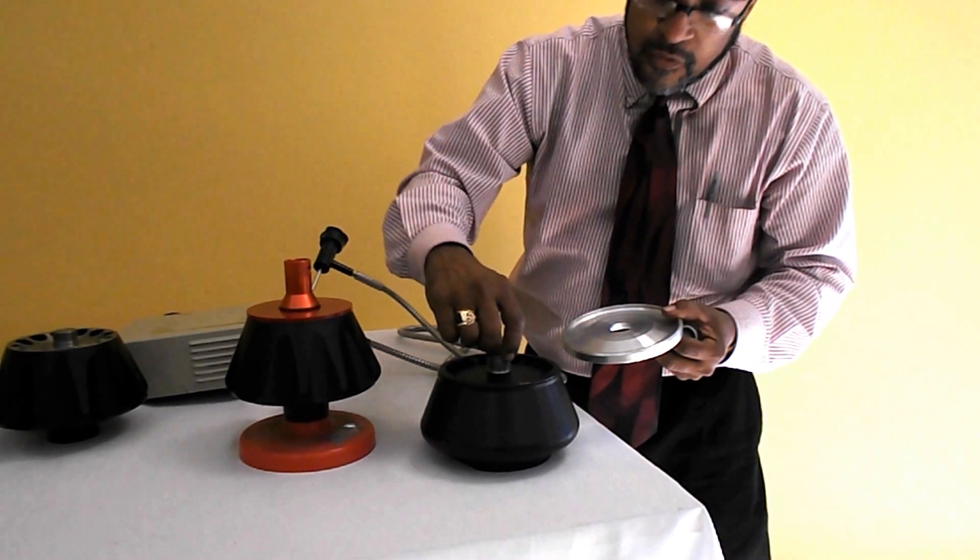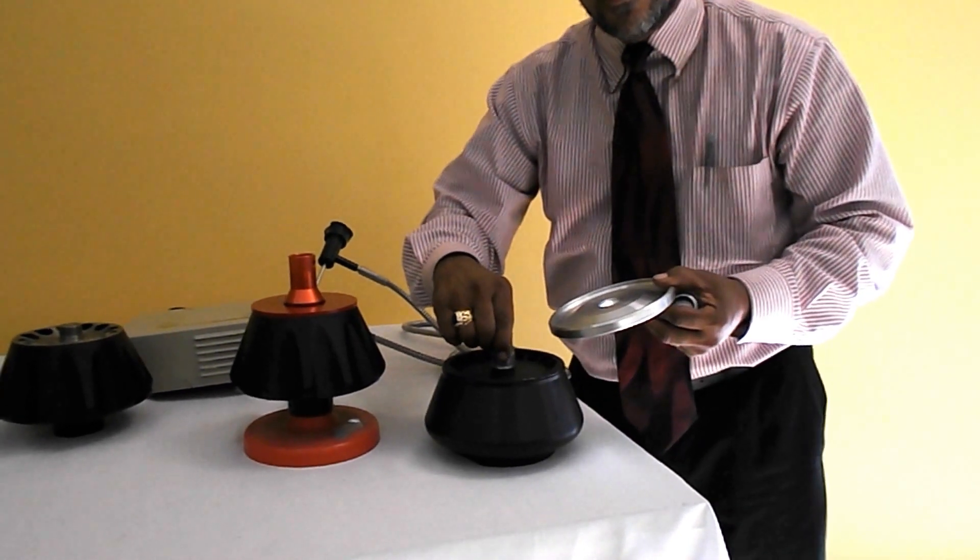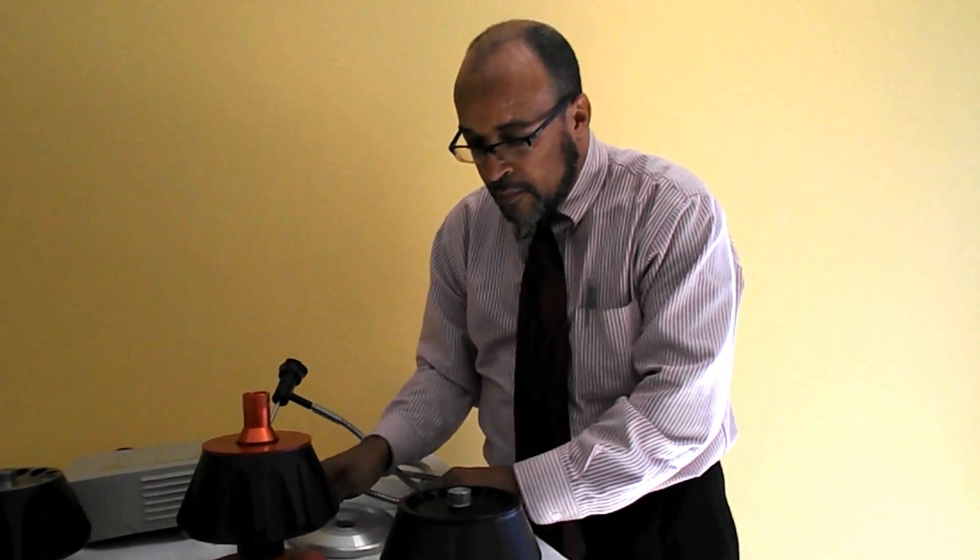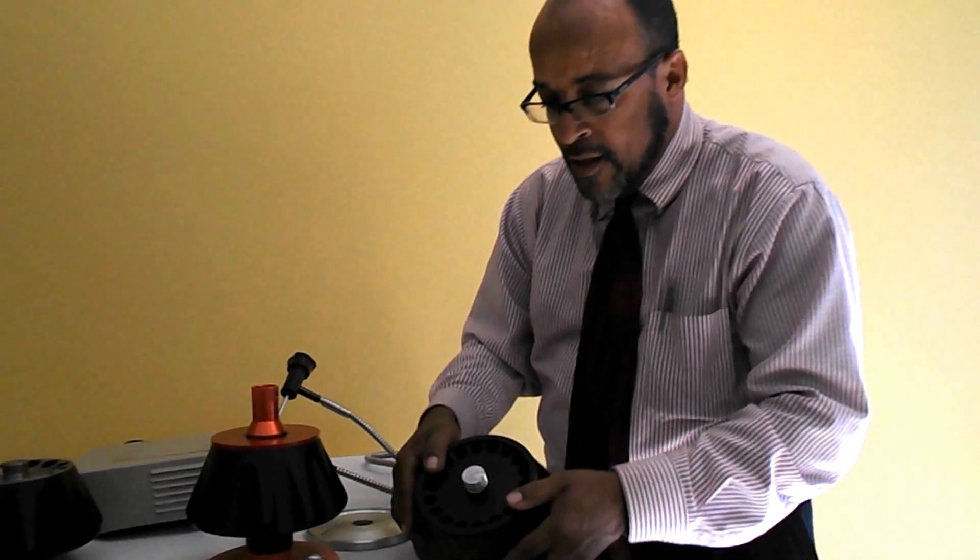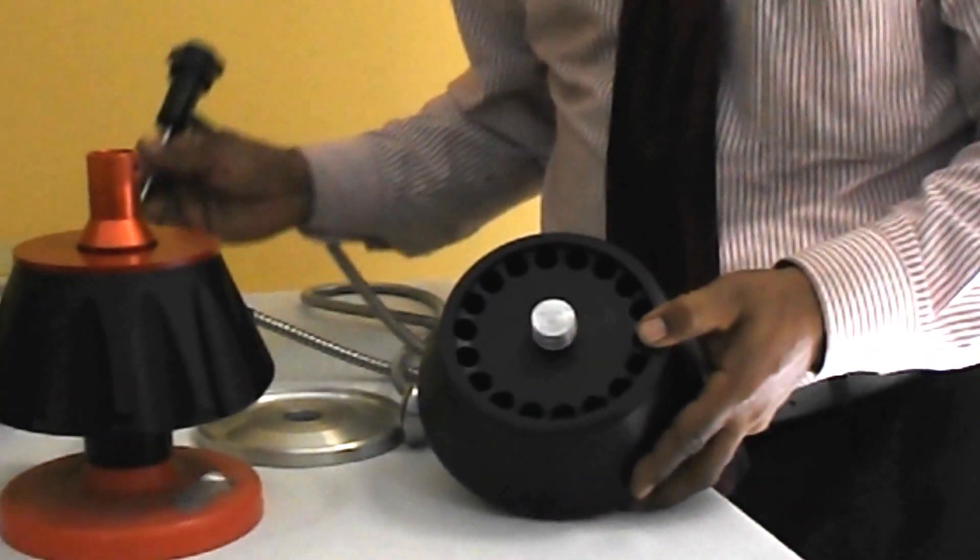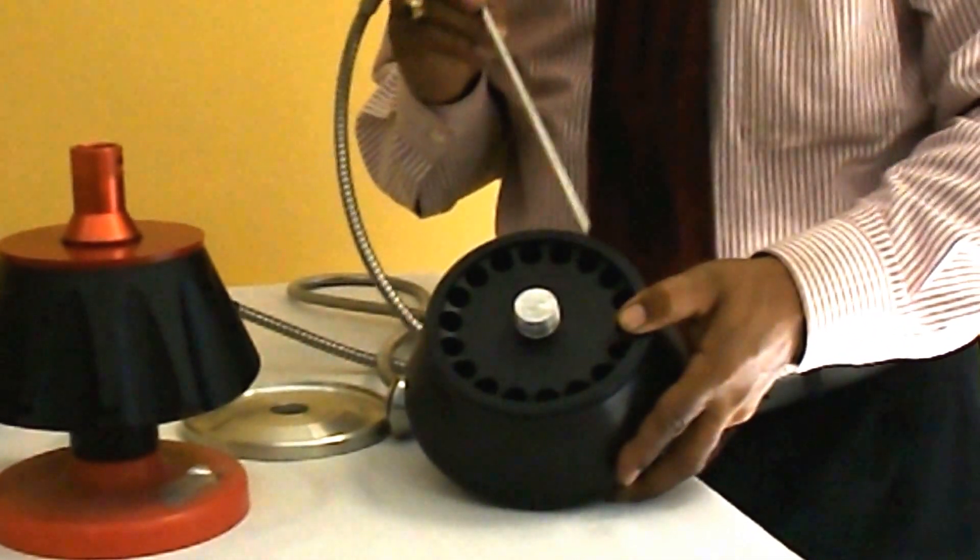And your threads, like the threads here, need to be lubricated with spin coat or some type of lubricant solution. As you will tell right off the bat, the inside of this rotor is anodized. That means that it is an aluminum based rotor.